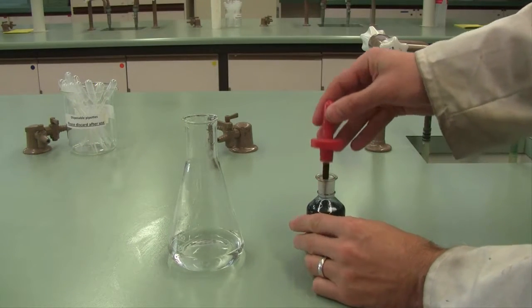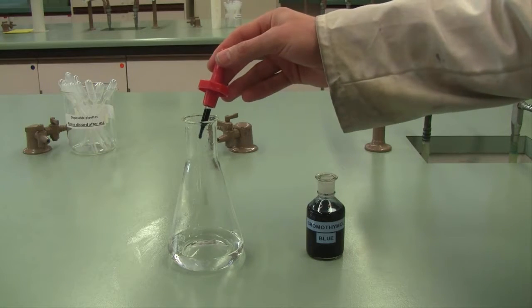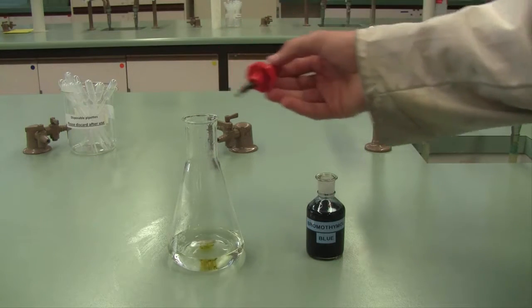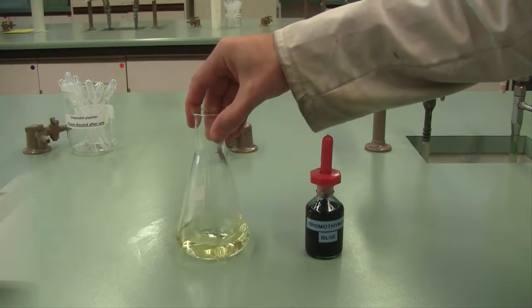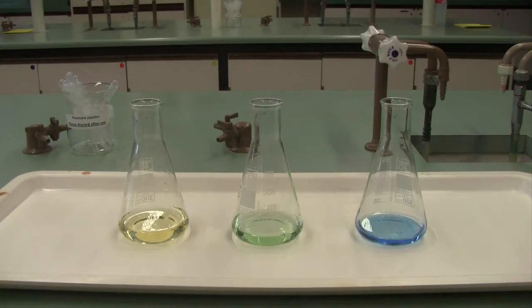Add three drops of bromothymol blue indicator, and proceed to titrate your unknown sulfuric acid solution with the same sodium hydroxide solution in your burette. The bromothymol blue indicator will present as yellow in acidic solution, green in neutral solution, and blue in basic solution.